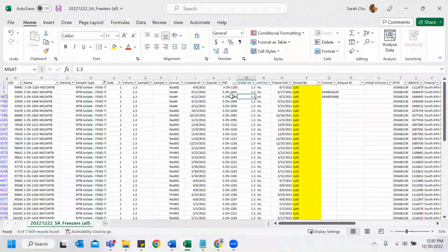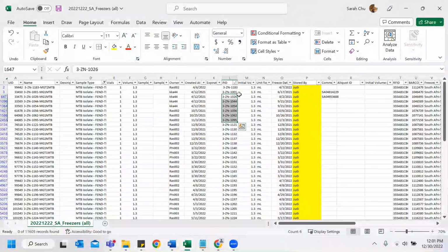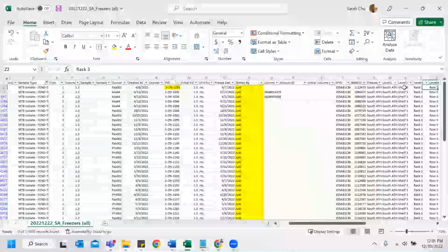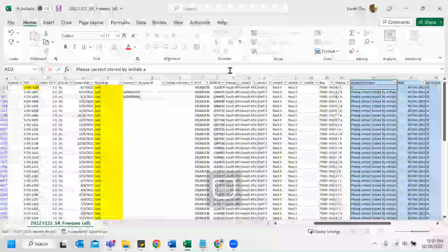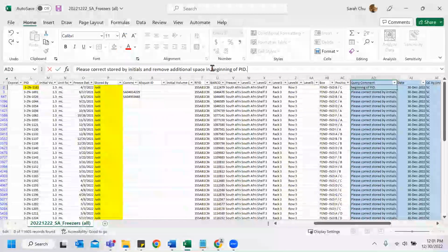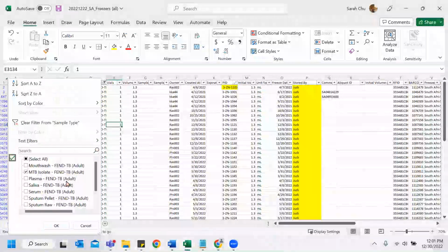But yeah, it does make sense why it's a bit strange, because if you do alphabetical order or order by size, this is first, which makes zero sense. So we're going to highlight that and also add a comment and remove the filter. So we're going to look at another section.